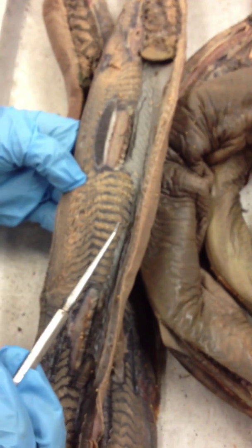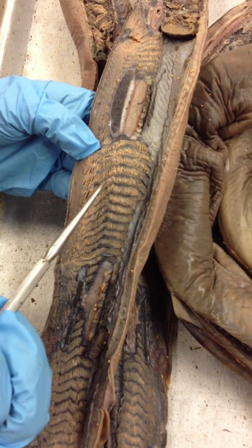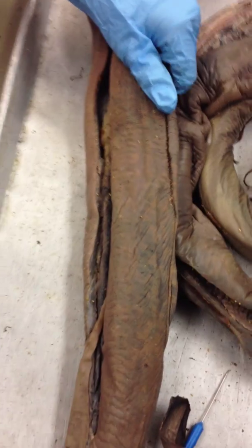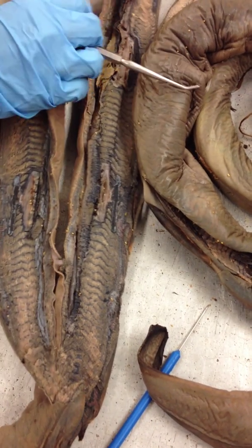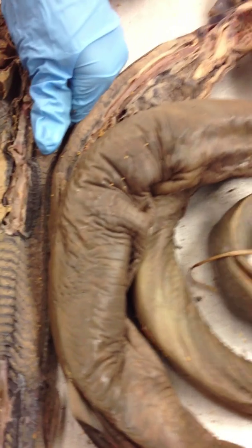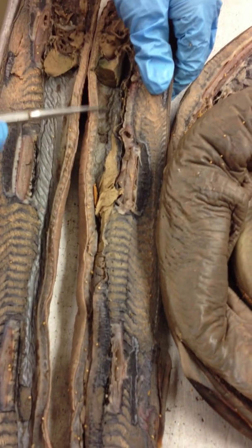This isn't on your lab handout, but these are your myotomes — the things you can find when you're eating it — with myosepta. But from the outside you would call these myomeres. The gonads are suspended from the dorsal wall of the coelom in the posterior part of the body. This whole cavity should be your coelom — this whole cavity that's open — and all these things are contained in the coelom.